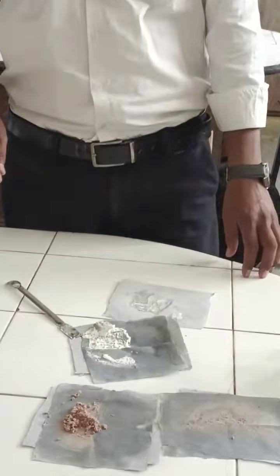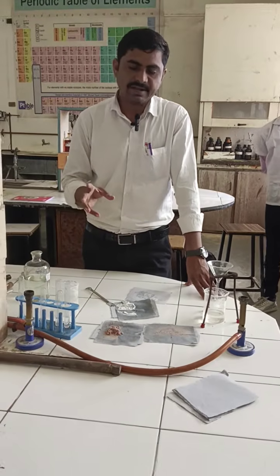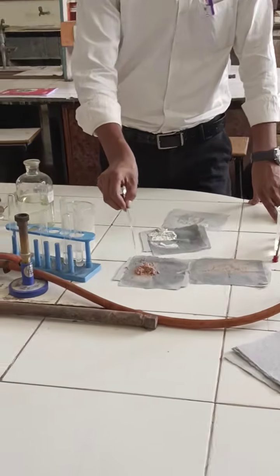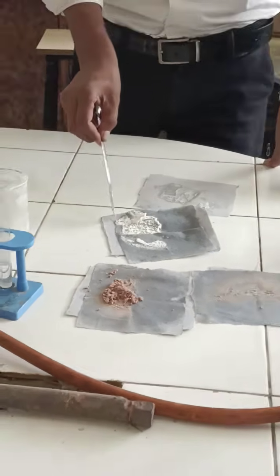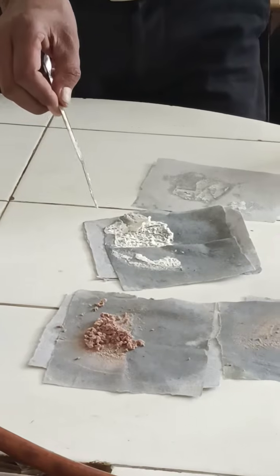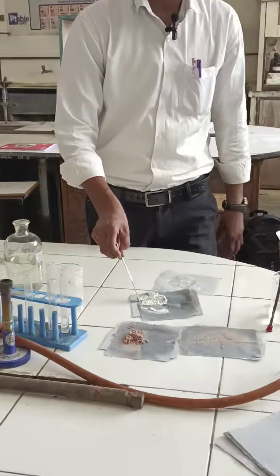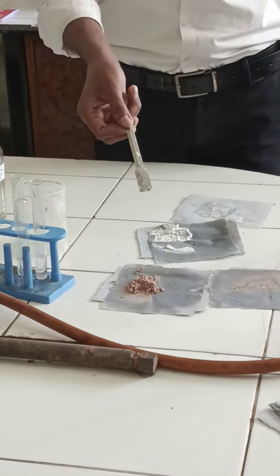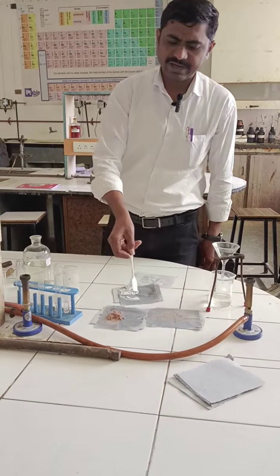So in this session we discussed and performed the separation of a binary mixture. In today's binary mixture there are two compounds. One is a faint pale color compound and the other is a white color compound. Both are solid compounds. The white compound is an acid, and the pale compound we can determine after performing tests.